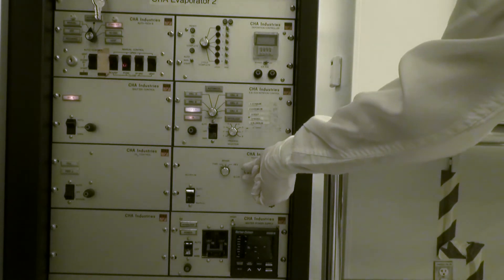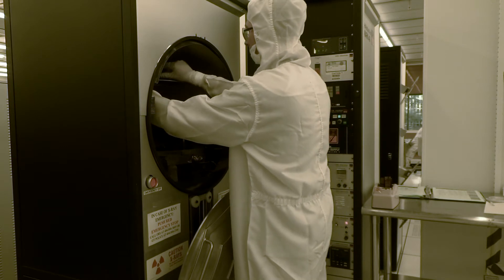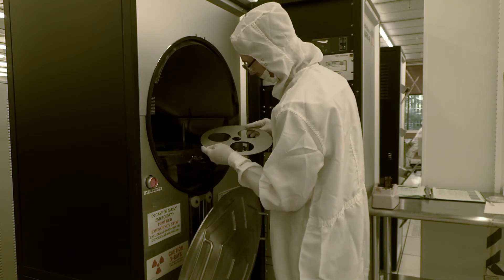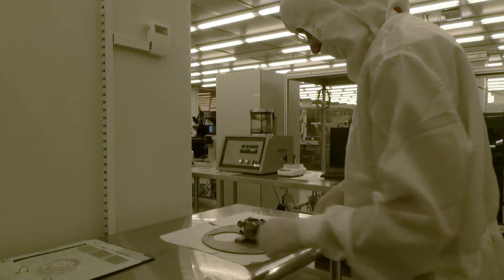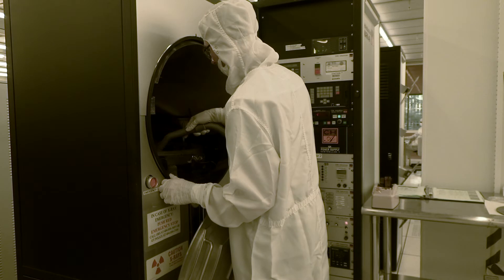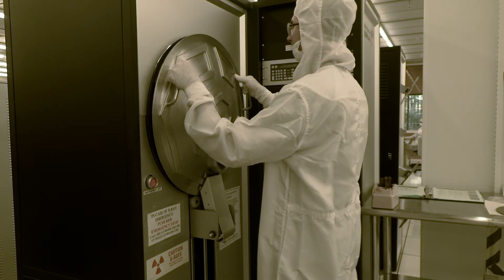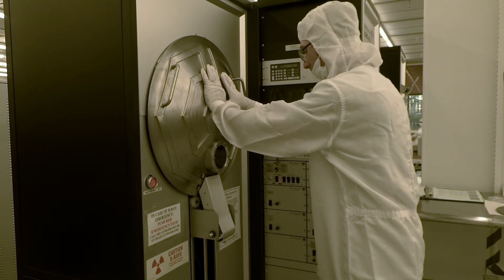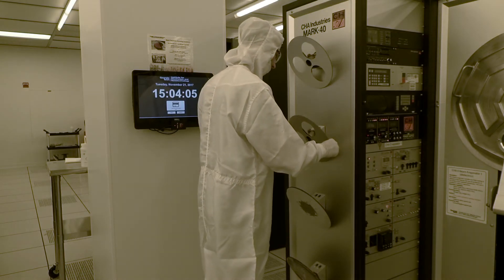Change the fixture control speed to slow and then move the rocker switch to the off position. Remove the sample tray from the roto-strate. The shutter control should be set to automatic. Place the sample tray on one of the nearby stainless steel tables. Carefully remove your samples from the tray, then place the tray back onto the roto-strate inside the chamber. Vacuum the inside of the chamber using the soft tip attachment to clean up any debris from the process run. Carefully lift the chamber door to the closed position to seal it. Move the rocker switch on the Autotech 2 controller to start to begin pumping the chamber down. When finished, log out of the e-beam evaporator at the access controller.